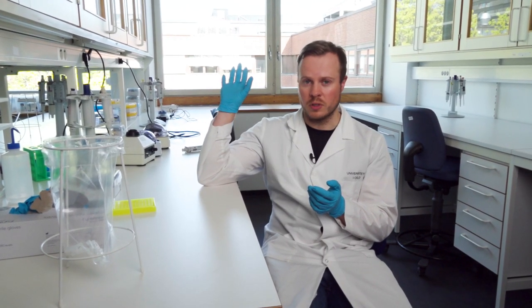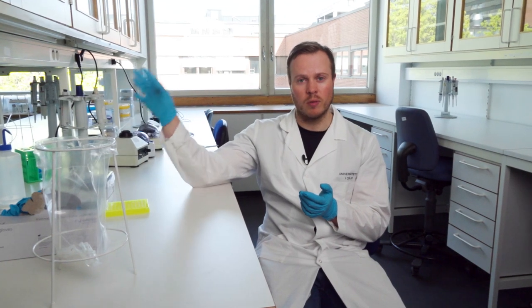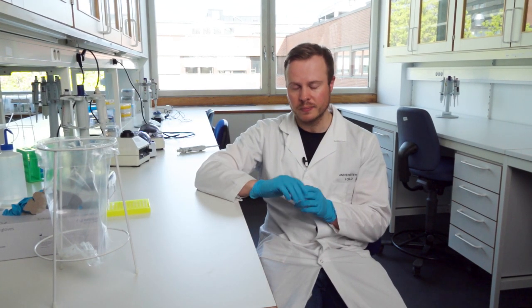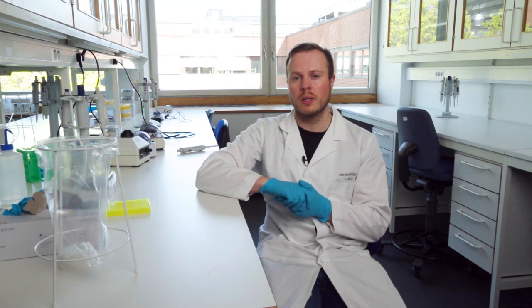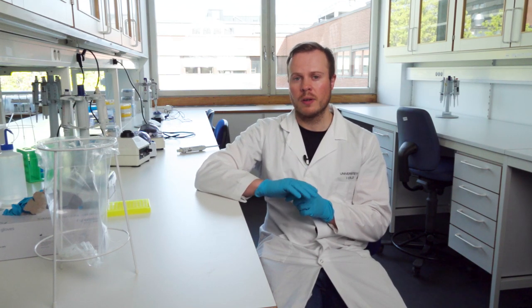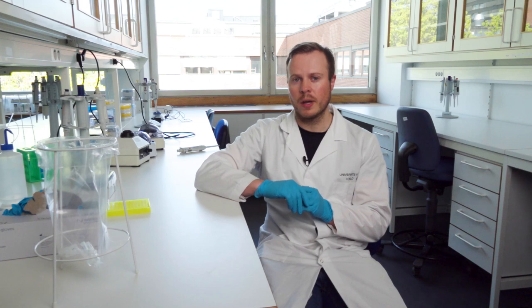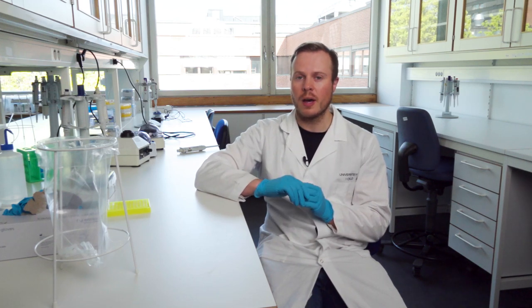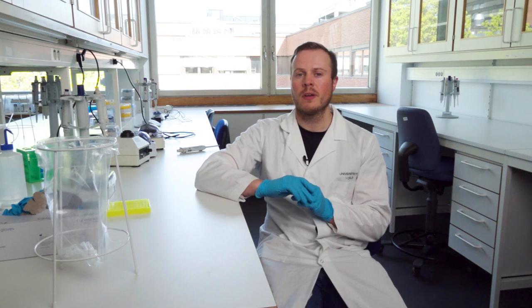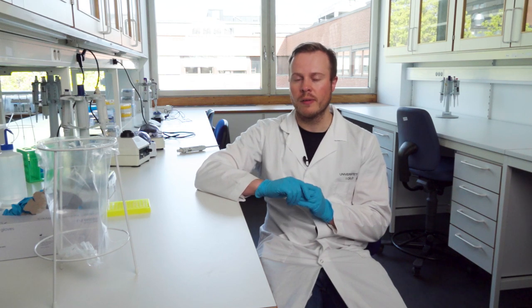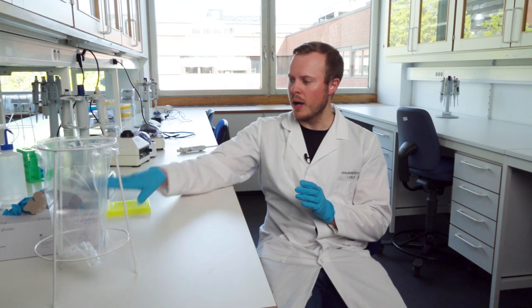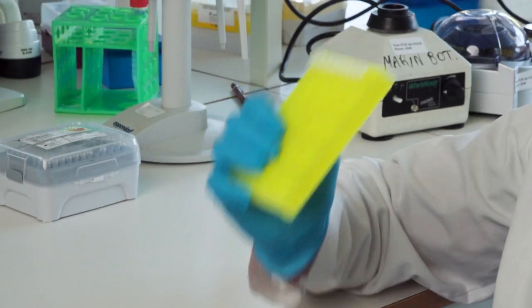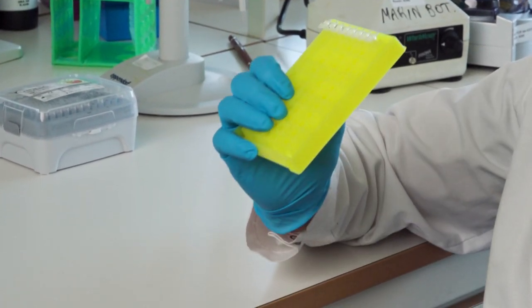This is all done with the same procedure for the gel as you have already watched—it's exactly the same, no difference. After that, we did another bead cleaning to purify the DNA, and this was done exactly the same way as previously, so nothing new there. And we now have the samples—they are now purified, they have been run through the gel, and now we are ready for the quantification.